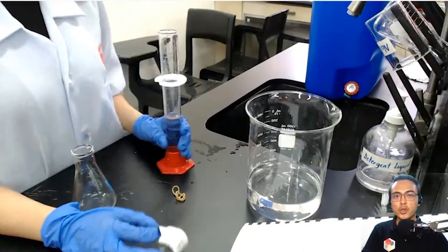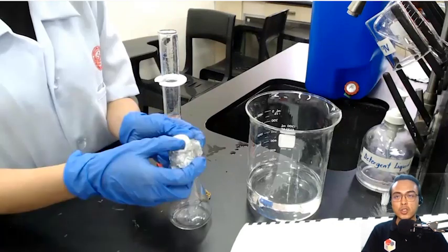Okay, after measuring the volume of the flask, just a quick recap on the data that we have already gathered. We now have the mass of the vapor inside. We also have the temperature of the vapor inside during heating, which we measured earlier. We also have the volume of the flask, which would be the volume of the vapor. So the remaining thing to measure is the pressure of the vapor inside. I have mentioned that the pressure of the vapor inside would be equal to the atmospheric pressure because there was a hole in our foil.